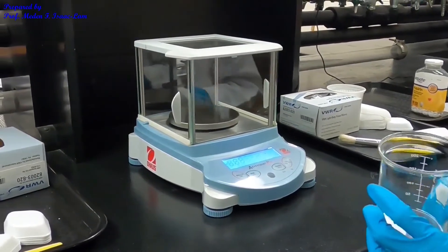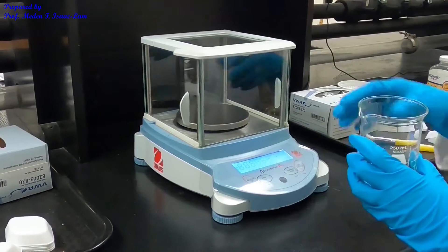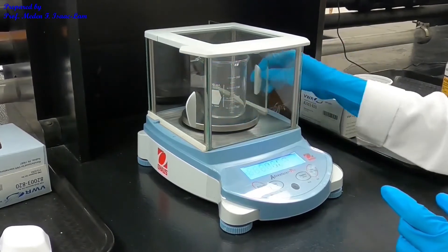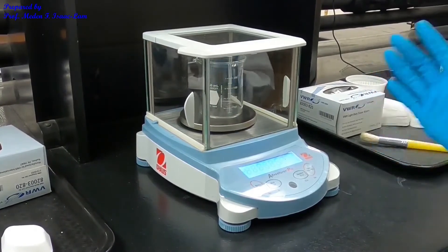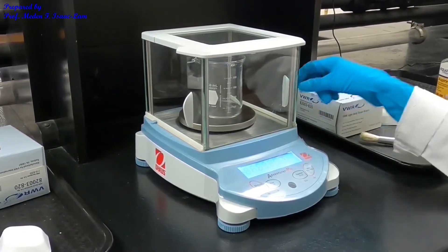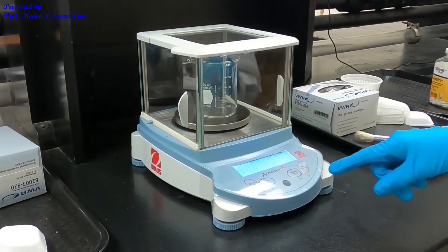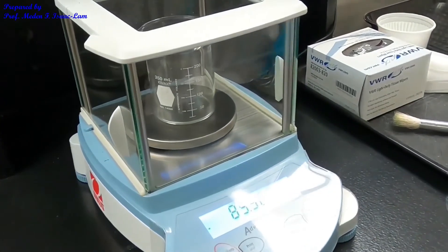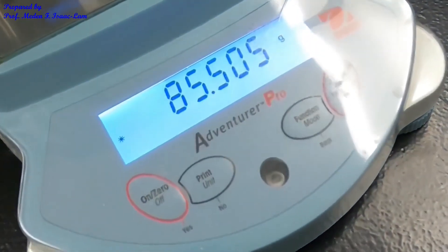Part B is now the mass of the beaker — the same 250 ml beaker. The balance starts at 0. The balance is the device used to measure the weight of any sample, liquid or solid. I place it on the pan and close the door. The weight of the beaker is 85.505 grams. The next step is to convert these into the English system.